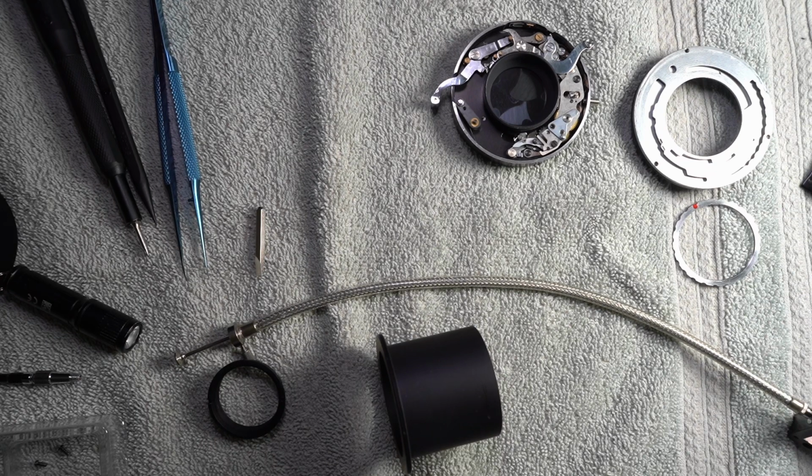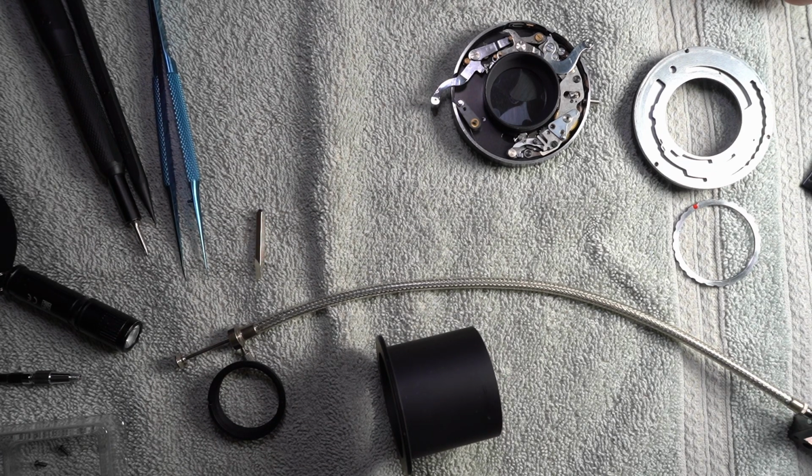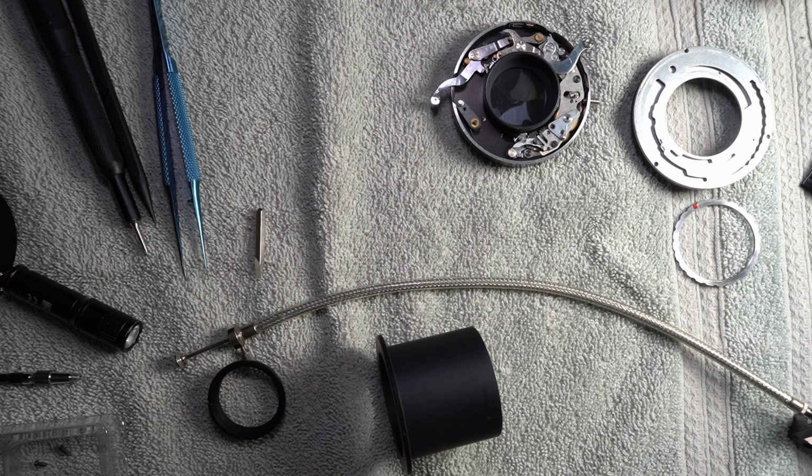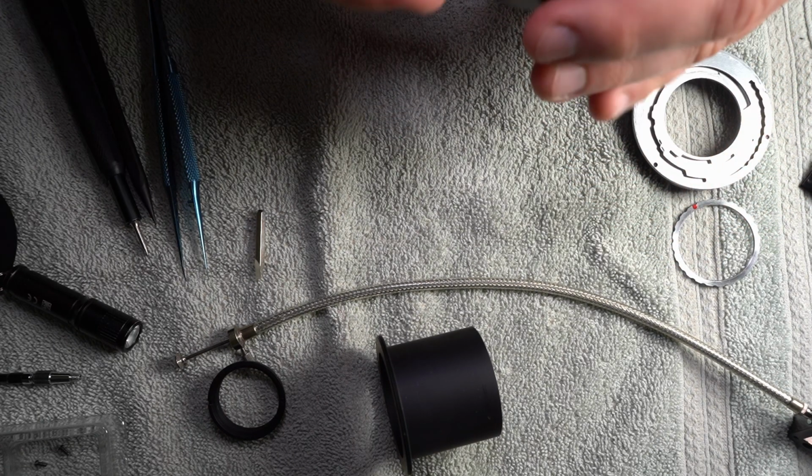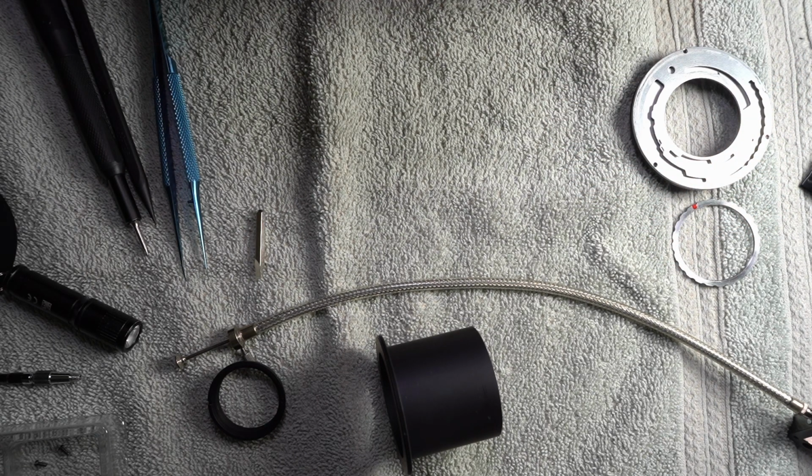What is that? Oh my goodness. I don't know what that is. That's weird. It really didn't dry out, did it? That fast? Oh, it's a piece of paper towel. Okay, good. There's something on the top of the grease that I was tripping over because I didn't know what it was. That's enough for that one. That is probably enough for that one.